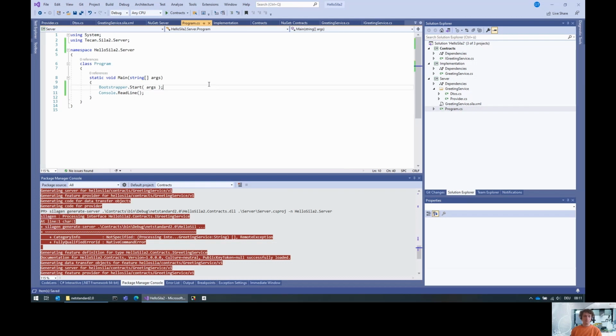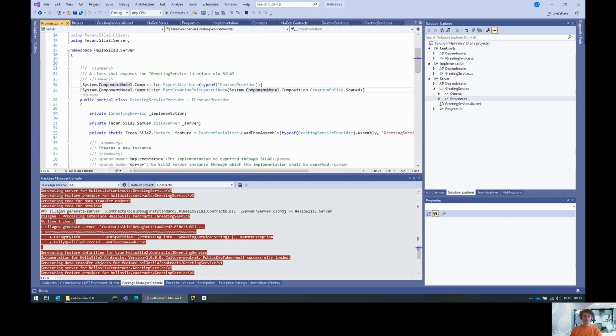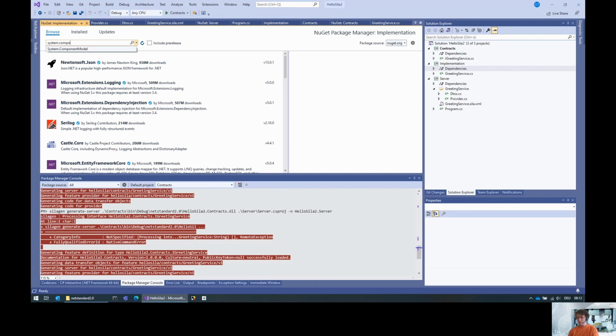Okay. There's one little thing remaining, and that is that this greeting service is currently just not referenced, so the server would not be able to find it. Now, as you can see here, the Tecan SiLA 2 SDK uses MEF to construct the objects. So what we need is to also add a reference here to System.ComponentModel.Composition.